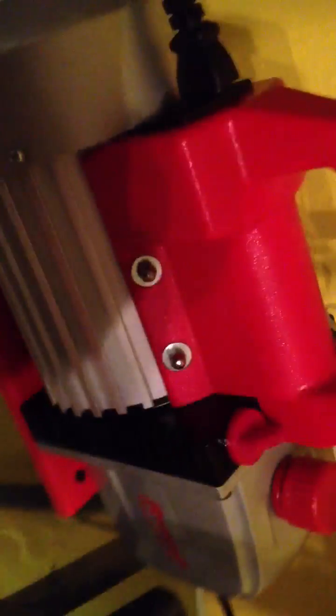I just got this all up and running. What I'm going to show you is we have some plain, basic water inside this flask here, sitting inside a water bath. The important part is this vacuum pump, which is going to suck a vacuum on all of the glassware you see here. Sucking a vacuum reduces the atmospheric pressure and effectively lowers the boiling point so that the water inside the flask will boil at room temperature.